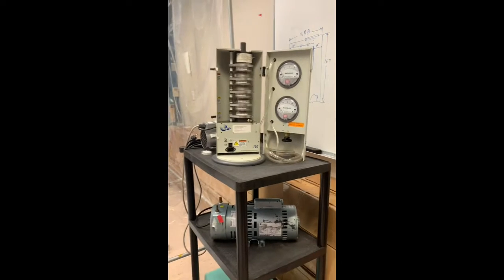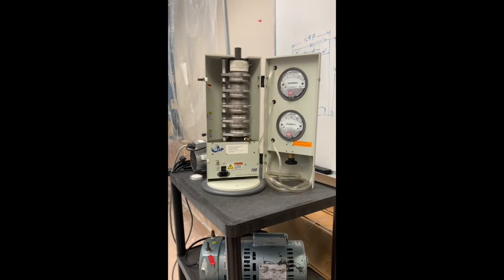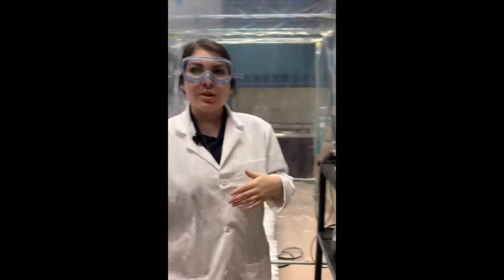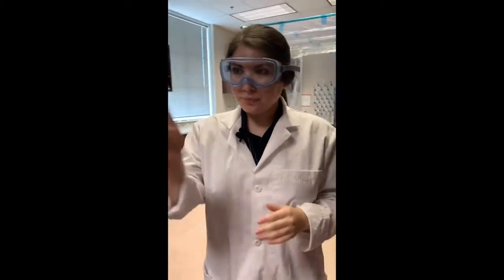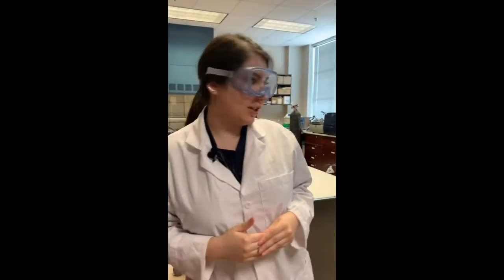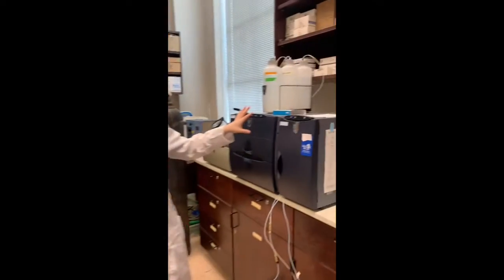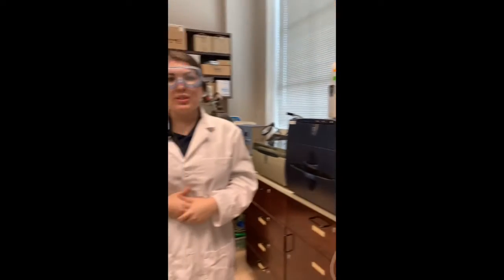And here students can understand particle size distribution by allowing material to go down through different sieves that have different mesh sizes. So if we go into our next lab, in here in 229, we have our ion chromatography. And our IC is actually able to measure different anions and cations in water samples. And this instrument can be seen here. We'll now go on to our other labs in our secondary hallway.